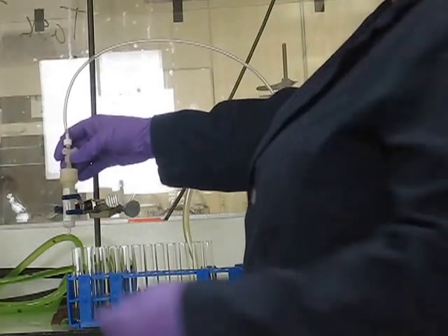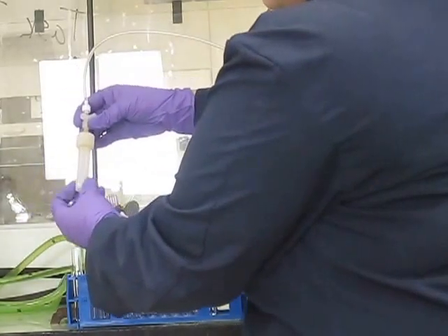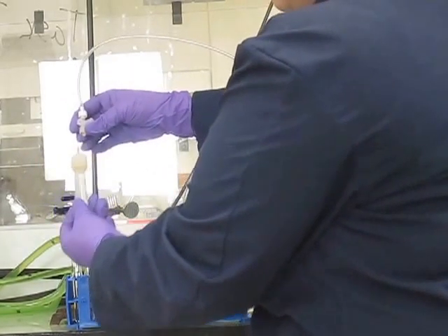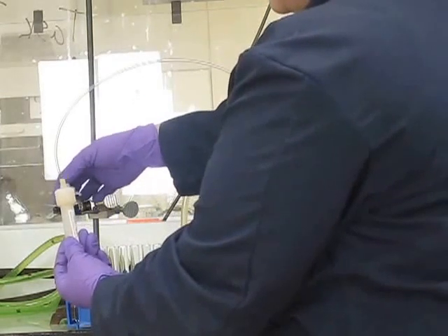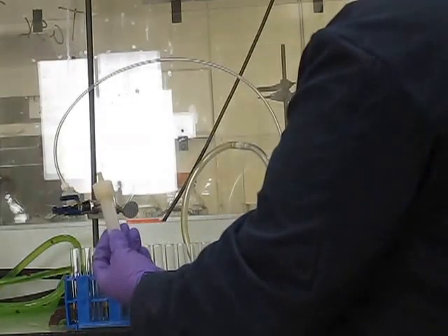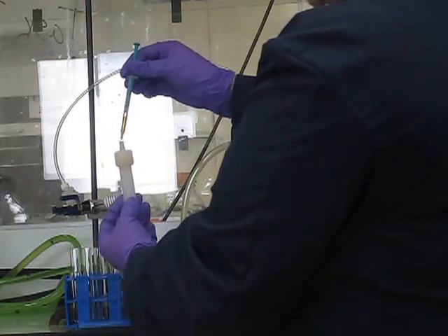To load your sample using a syringe, disconnect at this point and load your sample into the silica cartridge.